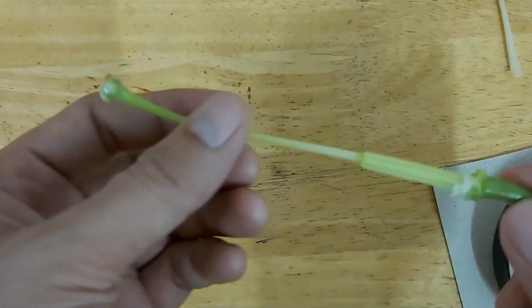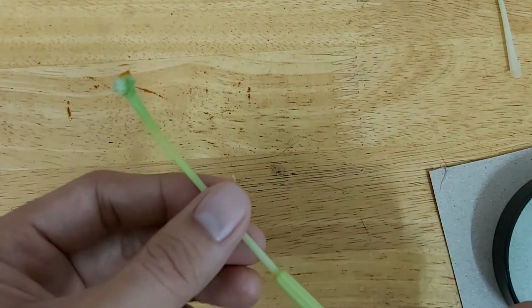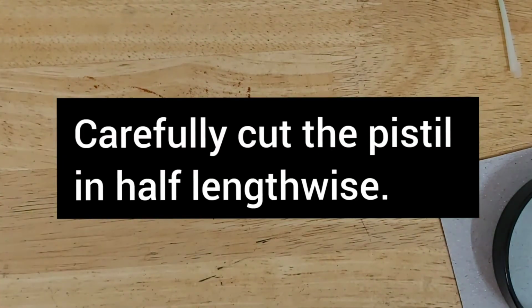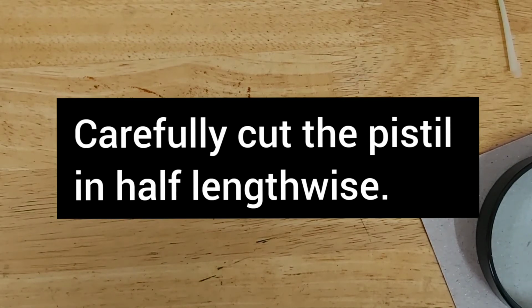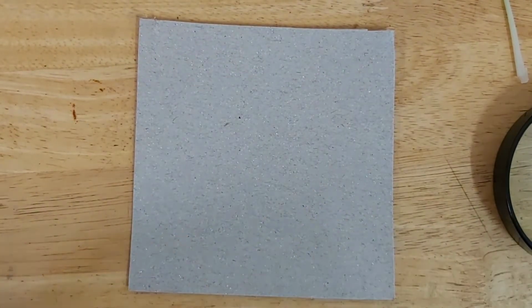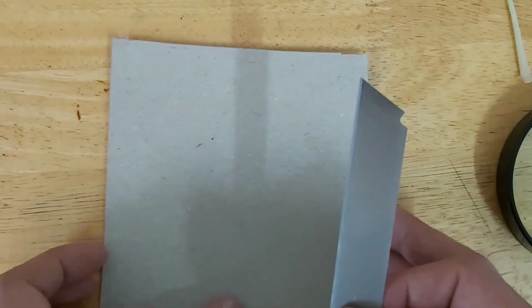And after that, you need to draw also the carpel. Label the three parts. We have the stigma, the style, and the ovary. Don't forget to label the parts. After the drawing, we are going to cut the pistil, which is the other name for carpel, in half lengthwise, making sure that your fingers are out of the way, of course. If your fingers are in the way, they will be cut also, so we don't want that to happen.